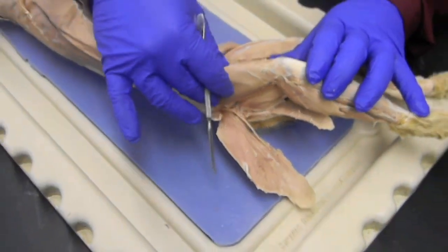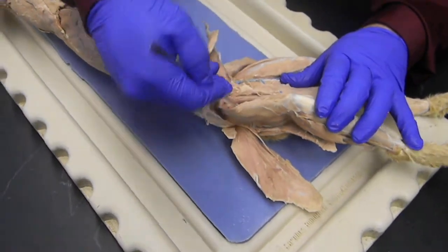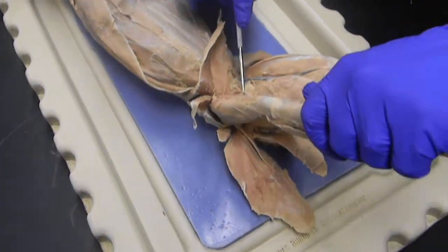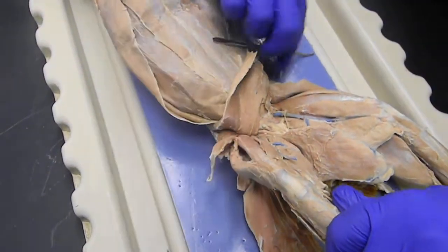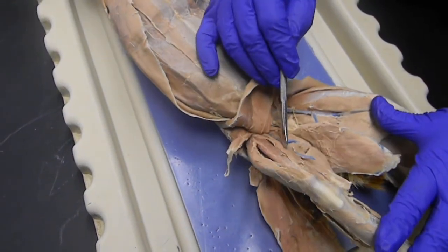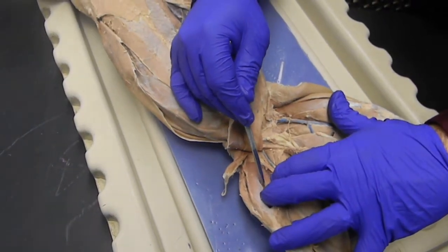We have the quadriceps femoris right here. It's separated into four pieces, okay? Sort of like a hot dog in a bun. The hot dog is the one that sits in the center. That's the rectus femoris. And then the bun is the vastus muscles. Vastus lateralis, the vastus medialis, and the one down on the bone on the inside is the vastus intermedius.